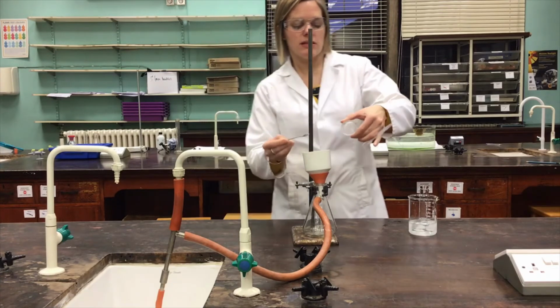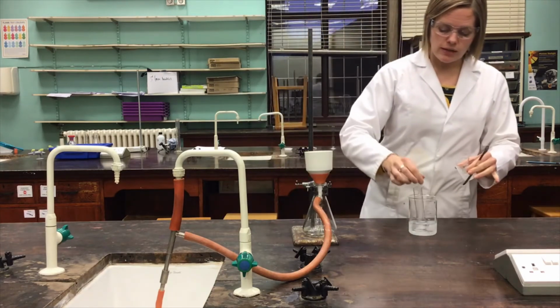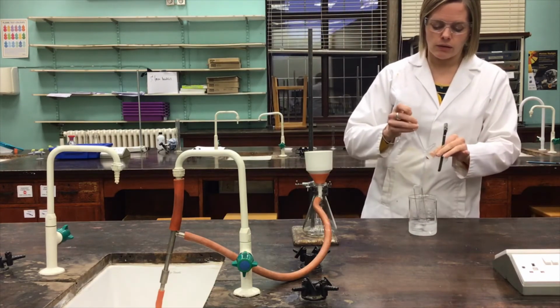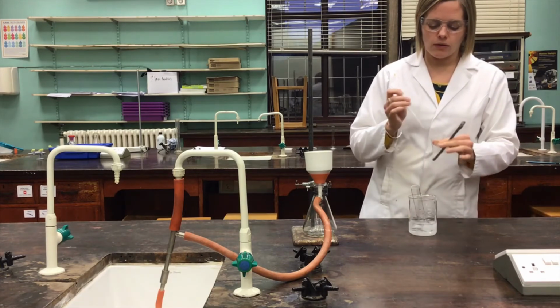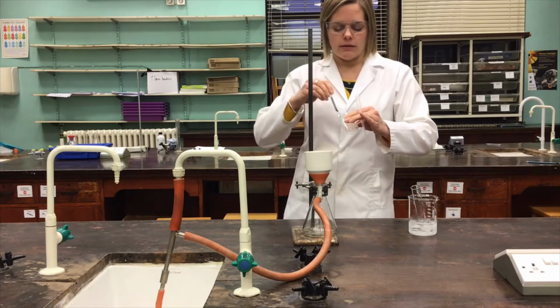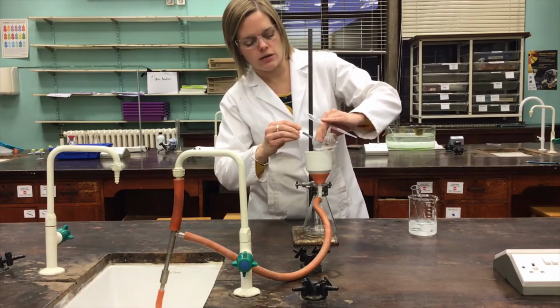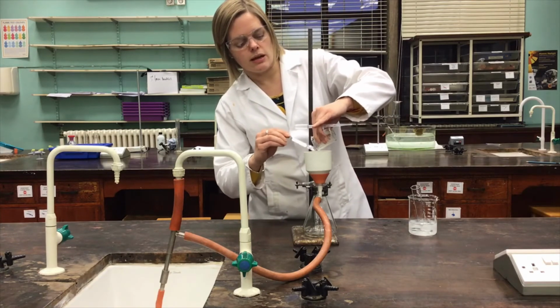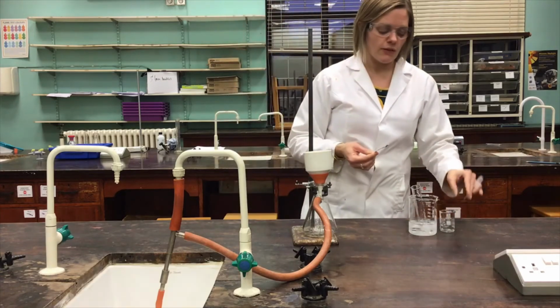Now you can perhaps see there's still quite a lot of this stuck to the side of this beaker. So if I take some of this ice cold ethanol, think about why it might need to be cold rather than warm ethanol, to try to rinse that beaker off, and again use the spatula to help with the transfer to minimise the amount lost, and just put that straight into there like so. I'm probably going to have to live with a little bit of that being lost on transfer.